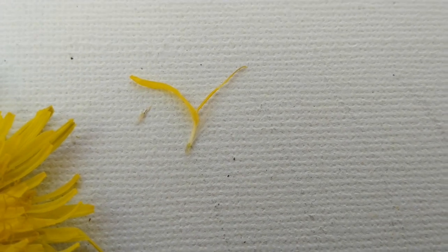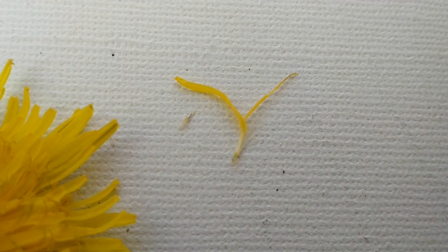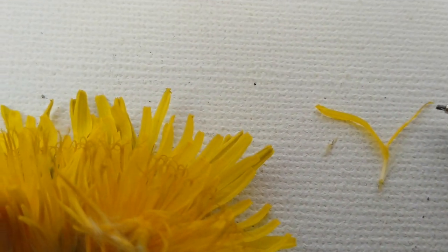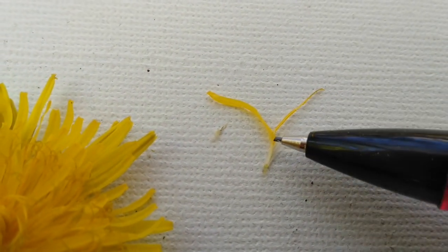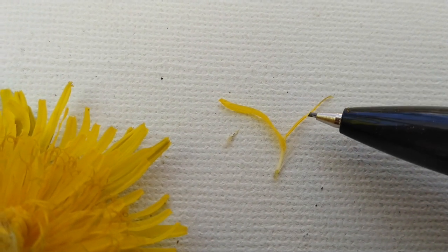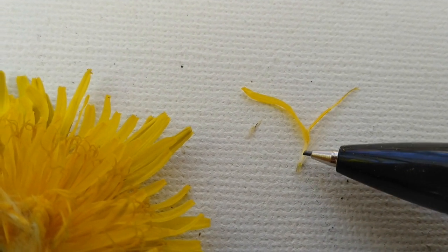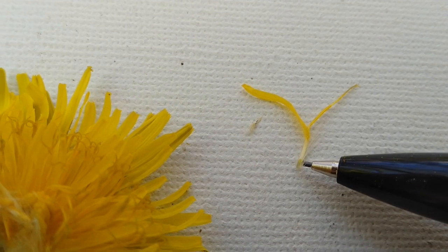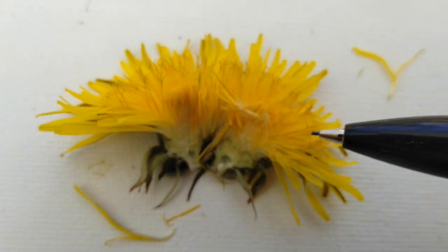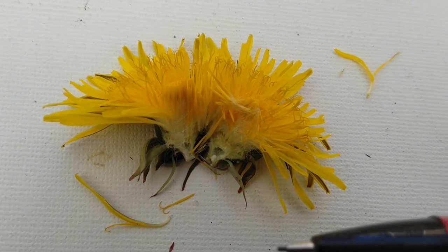Right, let's start with this part. So dandelions are a little weird, where they have lots of teeny pistils, and that is what this is right there. That's a pistil. And so this is where the little pollen will go and go down this tube into here, where it will develop into a seed, right? So when that seed develops, that is its own teeny flower, basically. This is just a collection of a lot of tiny flowers. It's a weird plant.